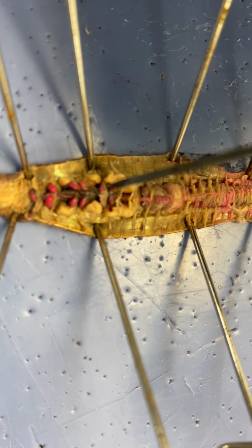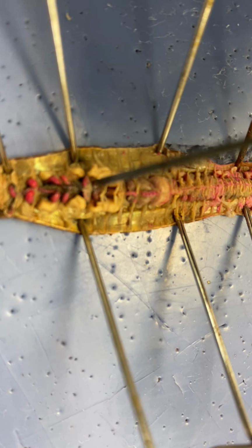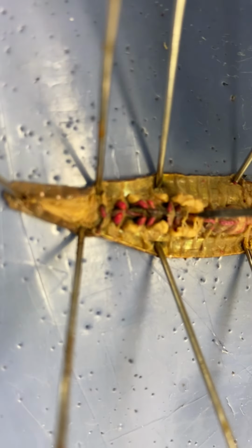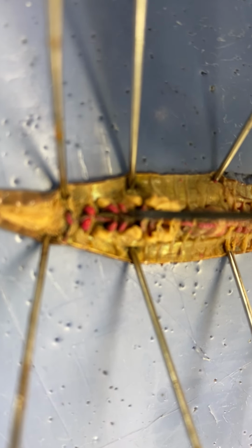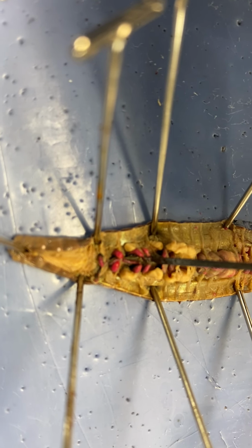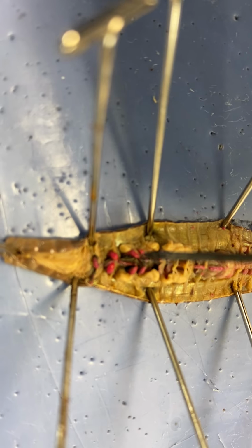There are supposed to be 5 pairs. Something 1, 2, 3, 4, and I think there's a 5th pair right there. So 5 pairs of aortic arches, and then underneath of it is the esophagus. So like the tube that runs, sorry, it's not focusing very well. This tube underneath the aortic arches is the esophagus. So mouth, pharynx, esophagus with the aortic arches.